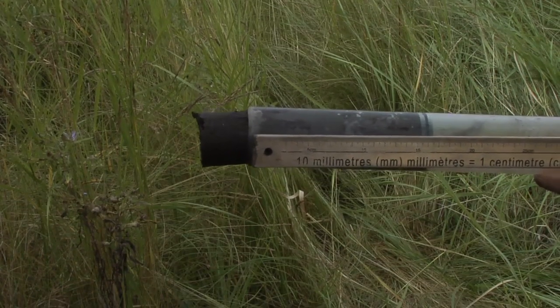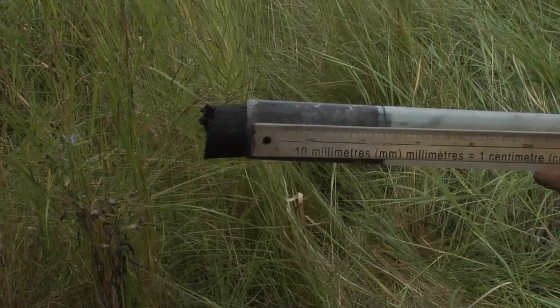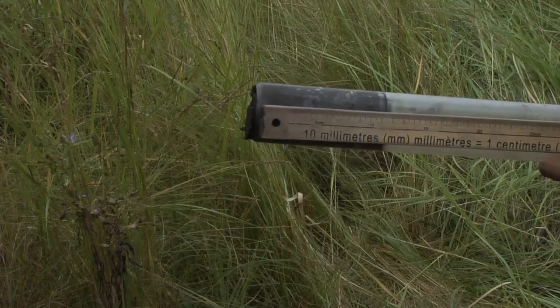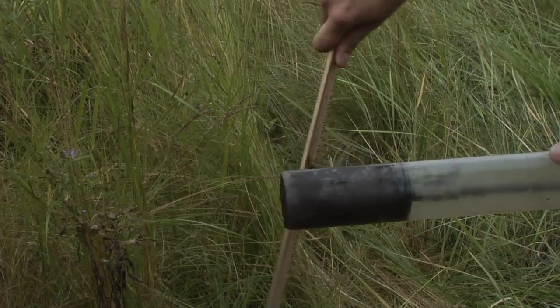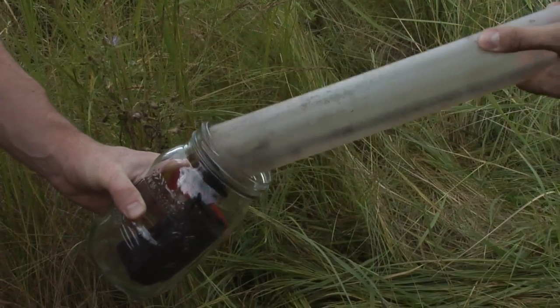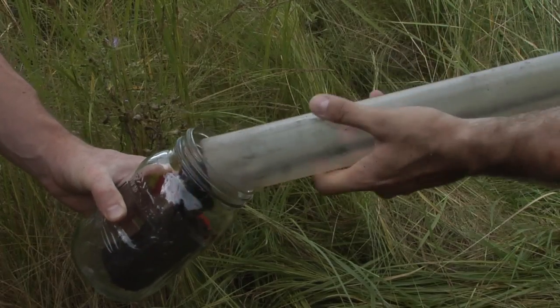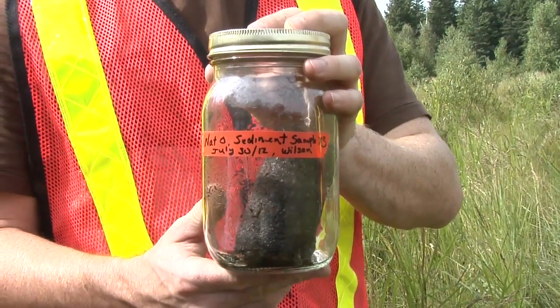Any type of corer that can collect a sediment sample of the same volume can be used, but we recommend a suction corer where the plunger seals the tube, creating a suction to retain the sediment in the corer. Deposit the sample in a labeled clean glass container. Do not use plastic storage containers, as hydrocarbons in the plastic may contaminate the sample.